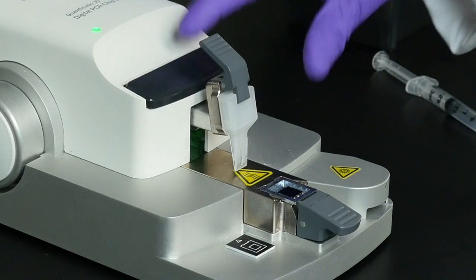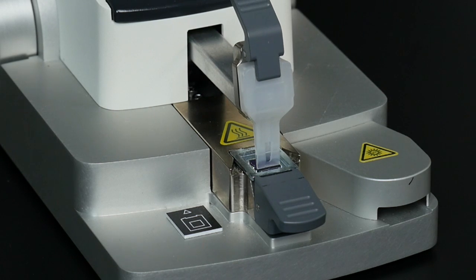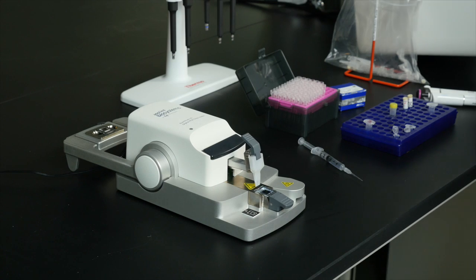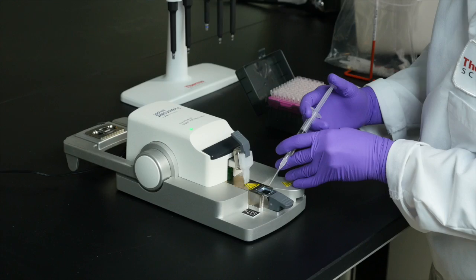With the push of a button, the dispenser loads and distributes the reaction mixture across the chip's 20,000 reaction wells. Once the loading arm returns to its starting position, apply sufficient drops of immersion fluid to completely cover the surface of the chip.